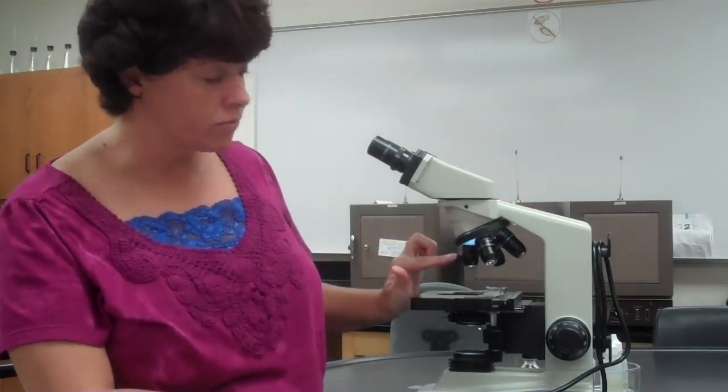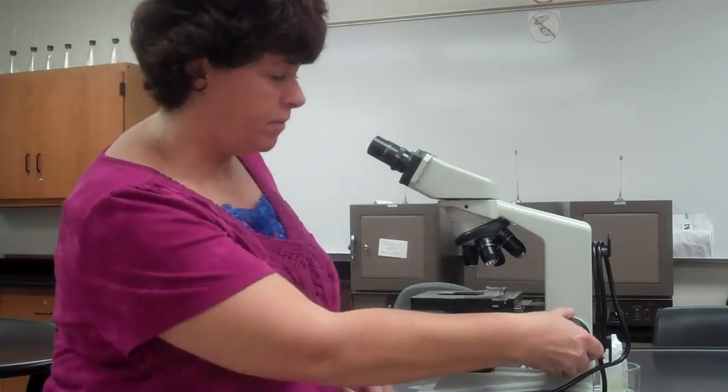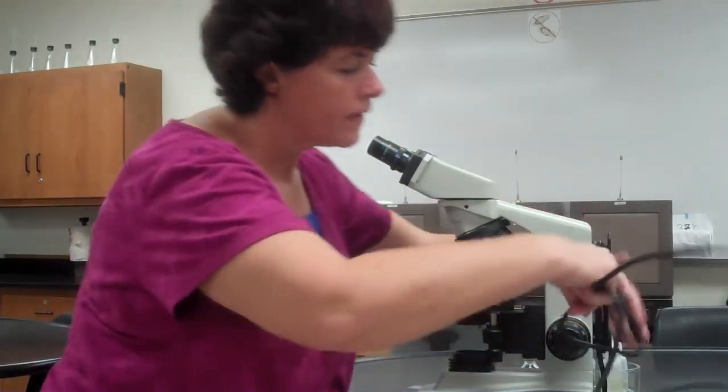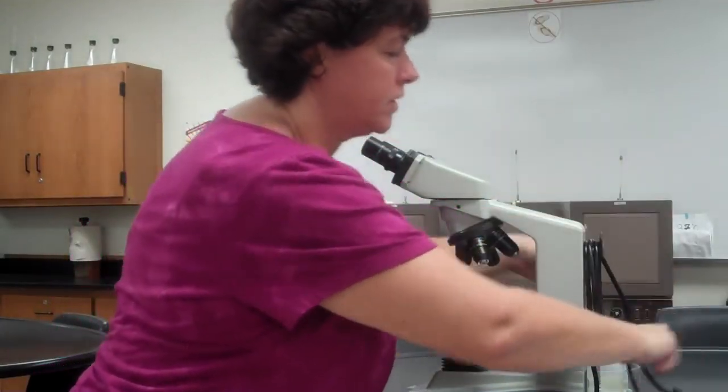Okay, now that I'm done, I want to put my microscope away correctly. So now I'm going to take it, always turn it to where the lowest power is facing down. You're going to turn off your microscope, lower the stage completely. You're going to center the little arm, and you're done. So now you unplug it, wrap the cord around the back. Probably don't need to do that for you.